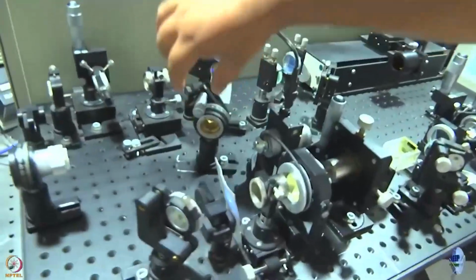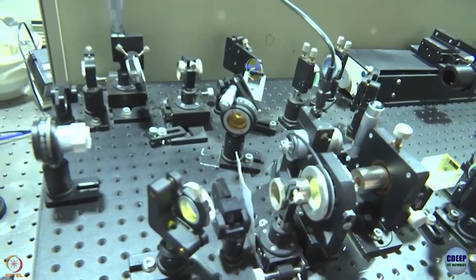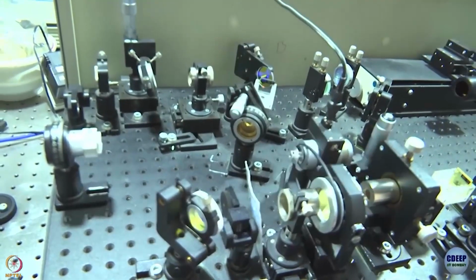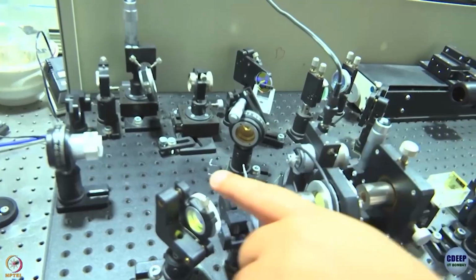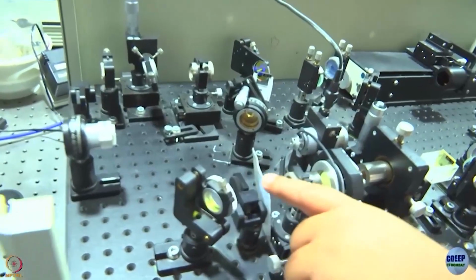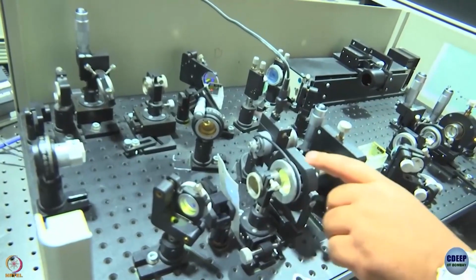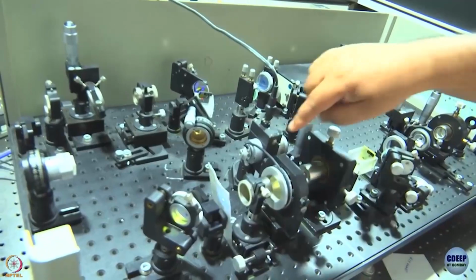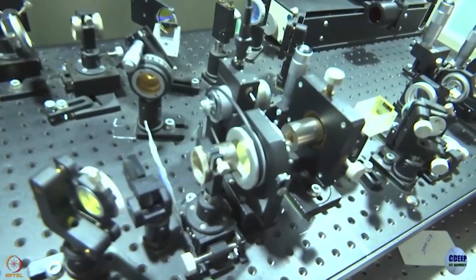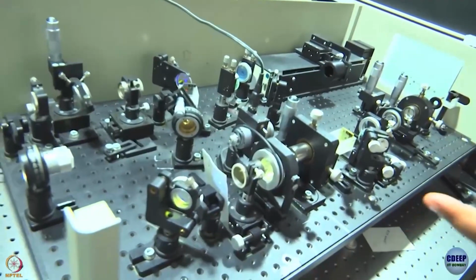This thing you see is called a Berek wave plate, because as you remember, you have to maintain magic angle polarization. If you are wrong there, your decays are not going to be correct. So, this is what is used to maintain polarization. This is a second beam splitter which reflects the blue beam and transmits the red beam. The blue beam is collected by this lens. Inside this cylinder there is a lens and it is focused on this sample. The sample we have is a liquid sample. So, we have to keep rotating it so that the laser light does not hit the same spot again and again, because if it does, then your sample is going to get spoiled.